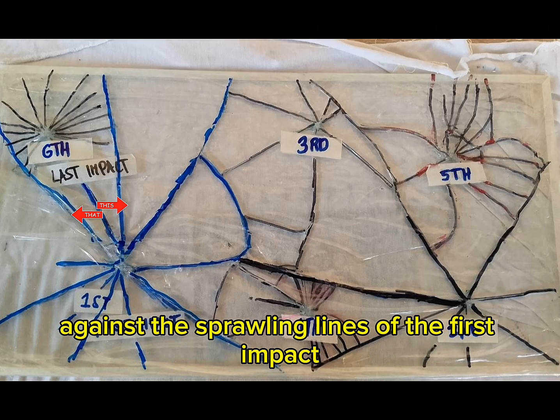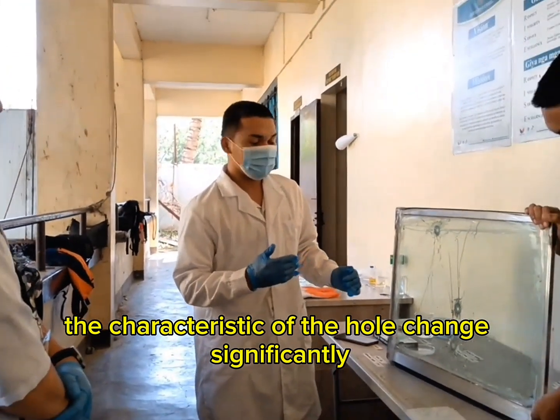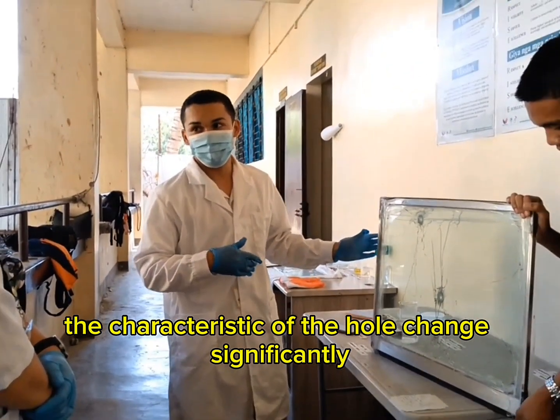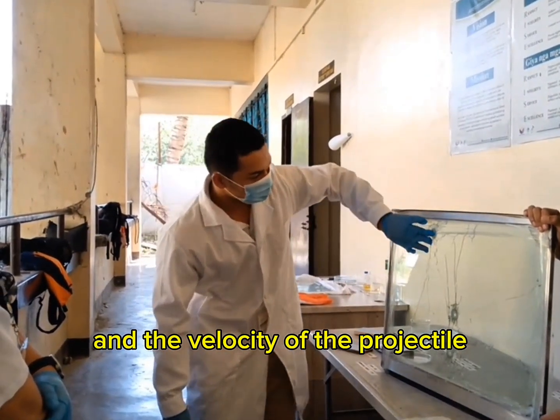While the last impact, this is the smallest, like a spider web, its fractures terminate almost immediately against the sprawling lines of the first impact. When a bullet strikes glass, the characteristic of the hole changes significantly depending on the distance of the shooter and the velocity of the projectile.